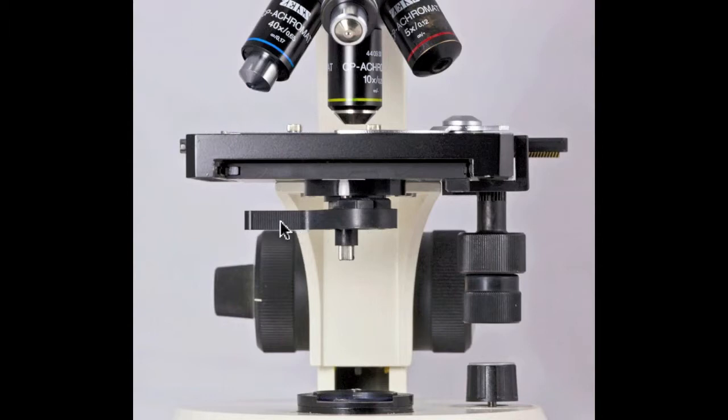There is a diaphragm lever attached to the condenser for changing the size of the aperture.